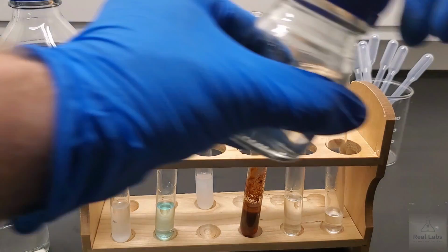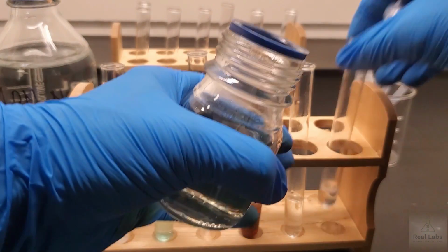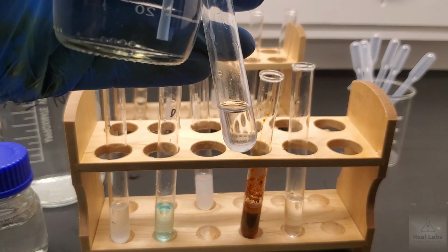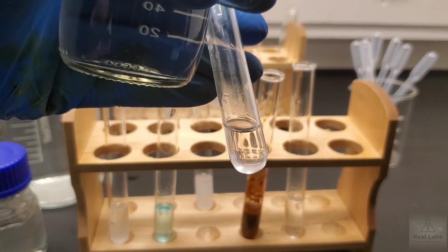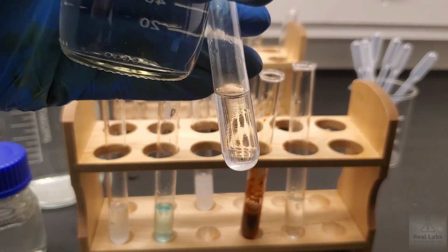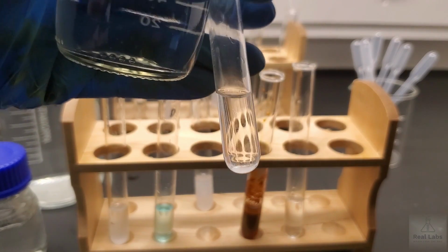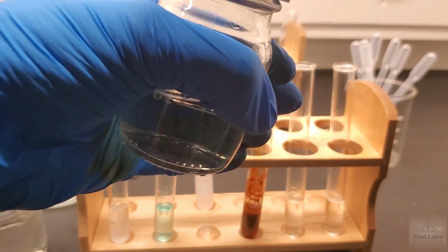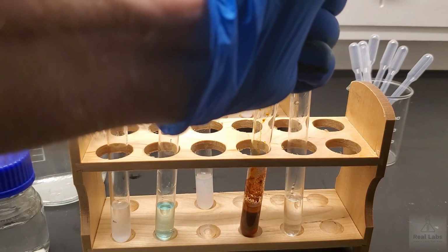And then we're going to rerun the second one, which was the nitric acid one. We're just going to try and keep that in shot again so you can see as I add the nitric acid what exactly happens. And again, you see good mixing, but once again, clearly no precipitate this time either. So I think this confirms quite clearly the sodium hydroxide was impure. There's no visible reaction in terms of solids or gases, and it does feel a bit warm again.